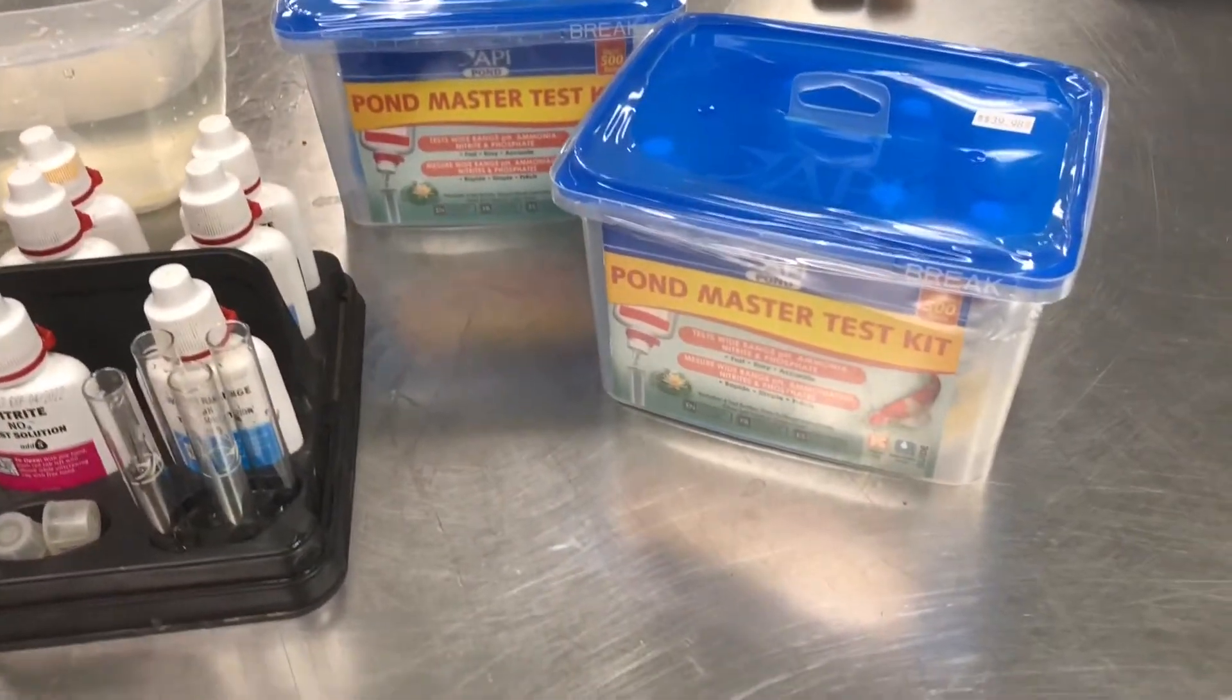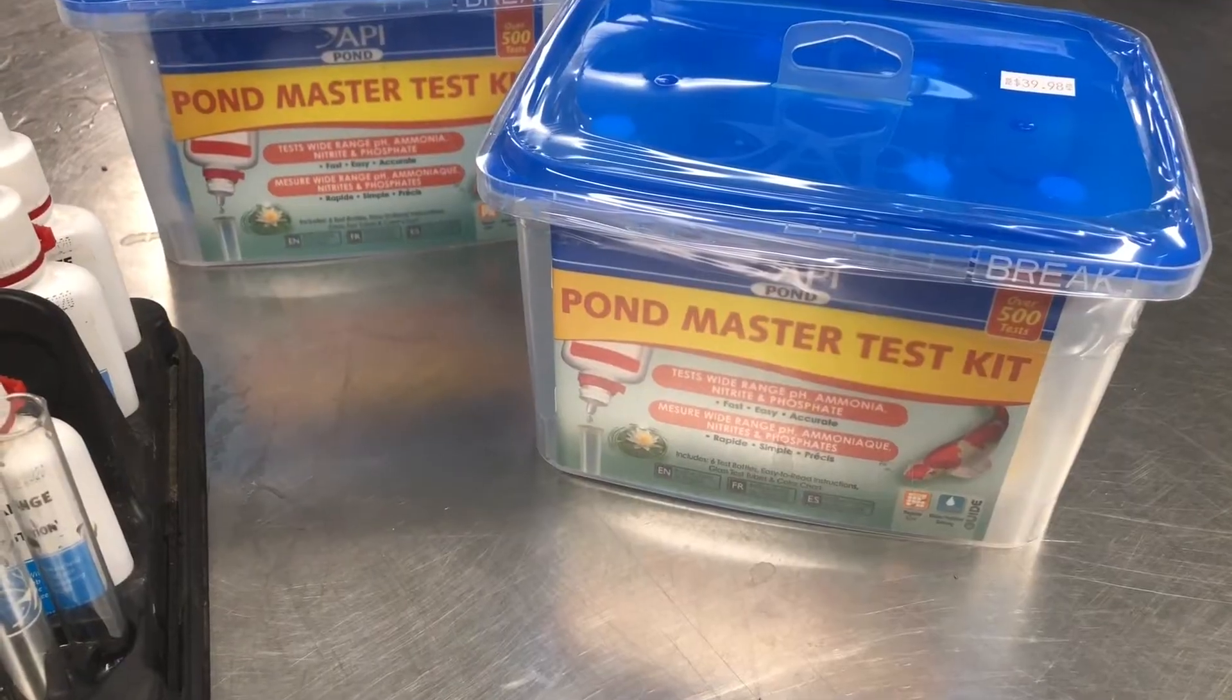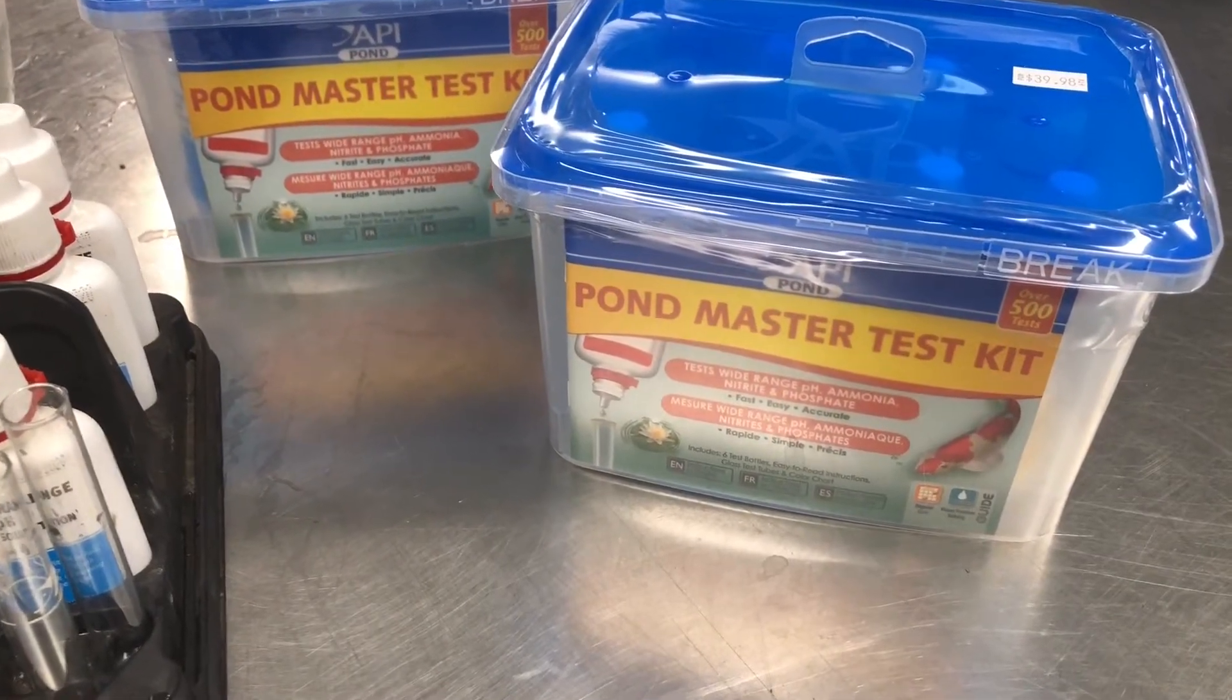Hey everyone, it's Jeff from Sunland Water Gardens, and today I want to show you how to use the Pond Master Test Kit from API.